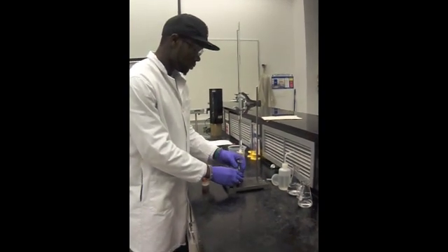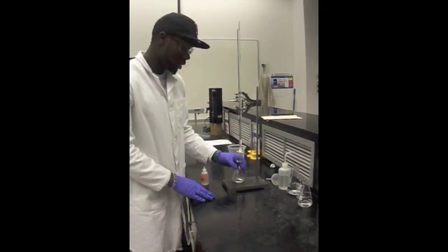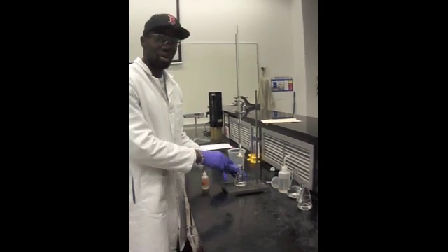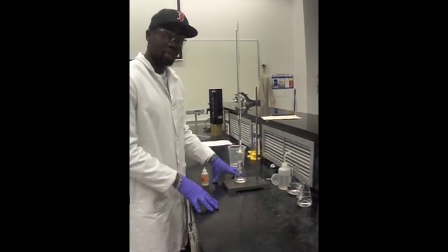Whenever you put the solution of KHP under the buret, you want to make sure that the tip of the buret is centered in the middle of the flask.